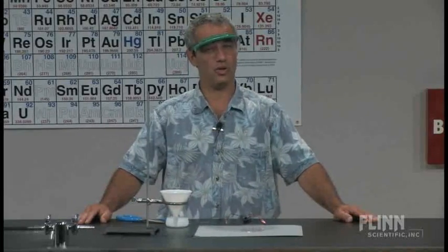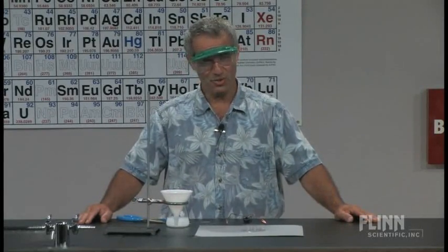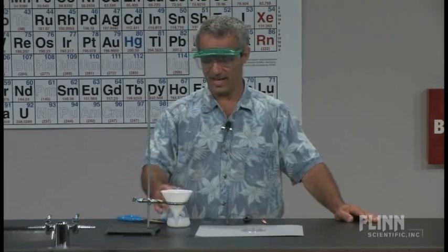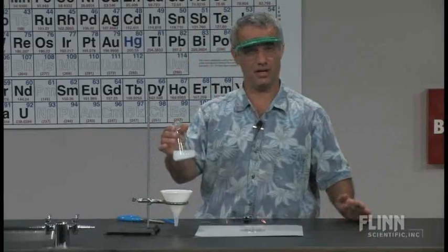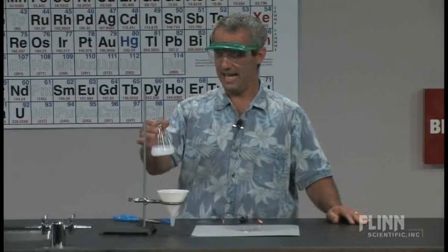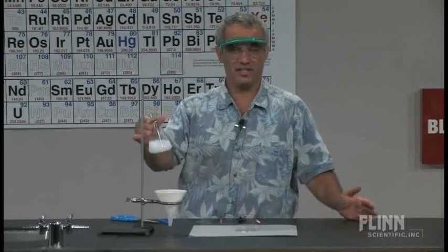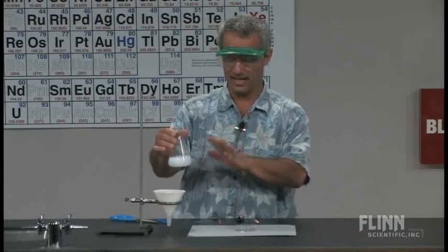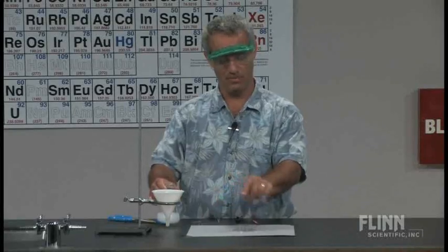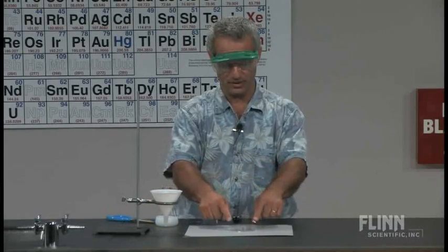An example of electrolysis of Tin-2 Chloride solution. I've got here about 5 grams of Tin-2 Chloride dissolved in 100 milliliters of deionized water. It doesn't look like it dissolves all that well, but this is just how I found it. You can add HCl, but you don't get the full effect. I like doing it like this and then just filtering it right into the Petri dish, and it's going to take place right here.